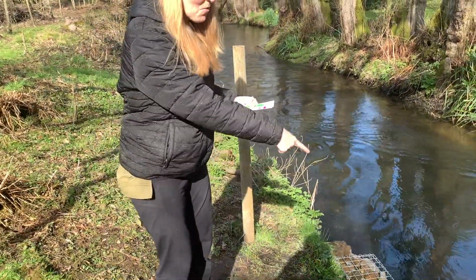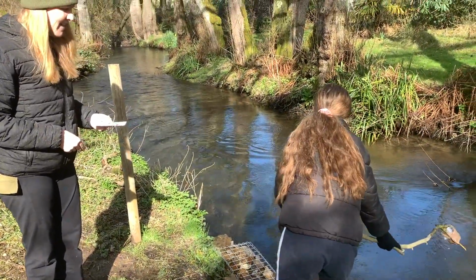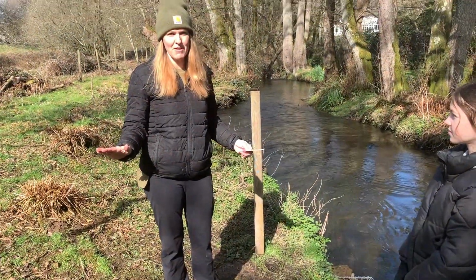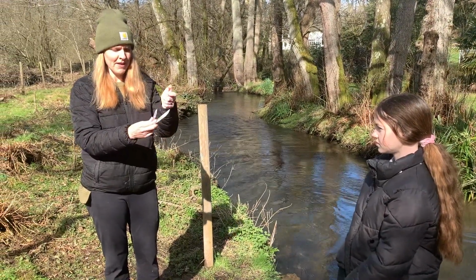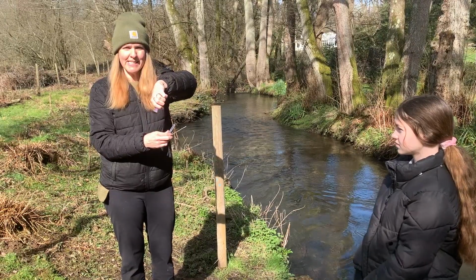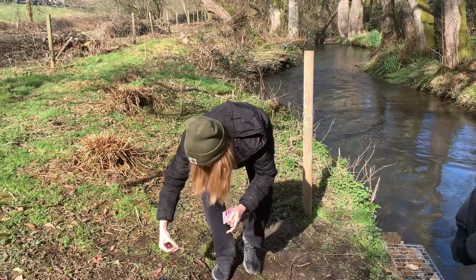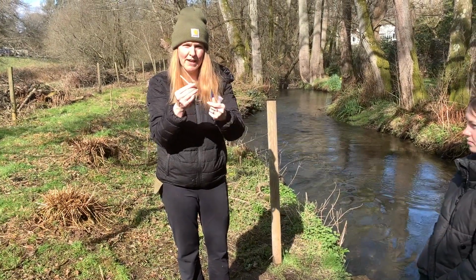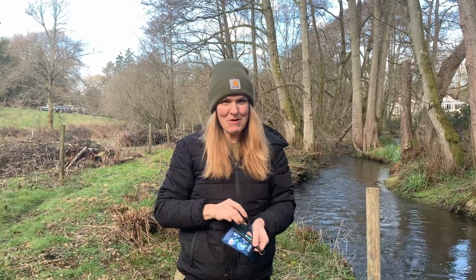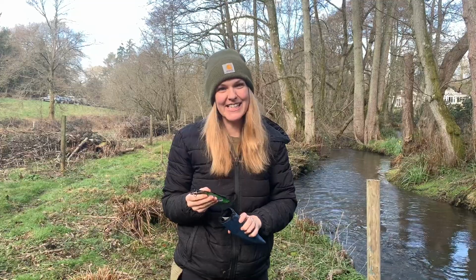So we can dump our water back in the river. We're going to leave the place better than when we arrived. When you get home, you can squeeze these into your sink and recycle them. Same with the test strips. Take these little pads off with your finger, and then you can recycle the stick. So I hope you had a good time water testing, and we will be in touch shortly to share our results.